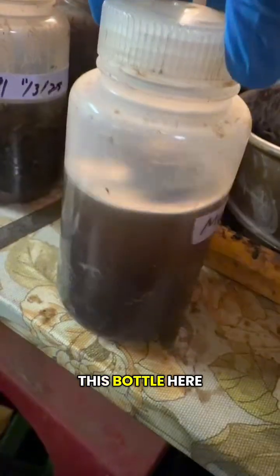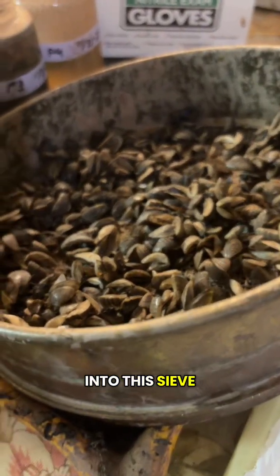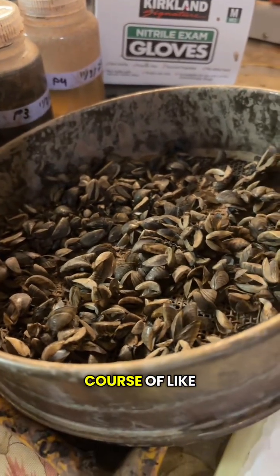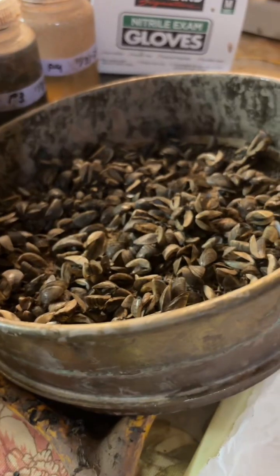So we're going to be working with this bottle here, which I've already dumped into this sieve and let them dry over the course of like 24 hours because they're a lot easier to work with when they're dry.